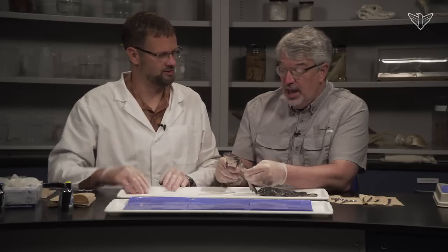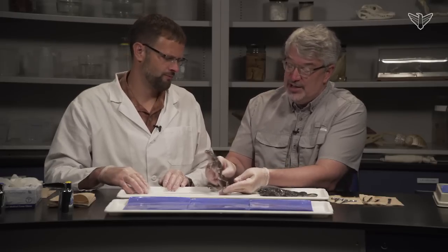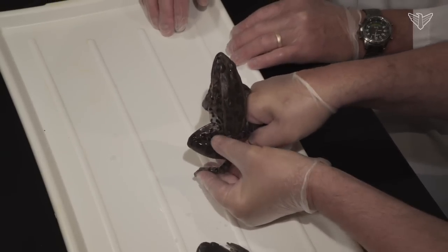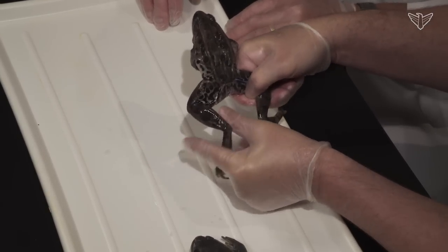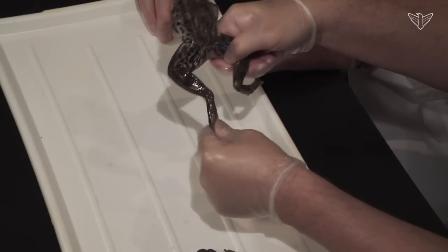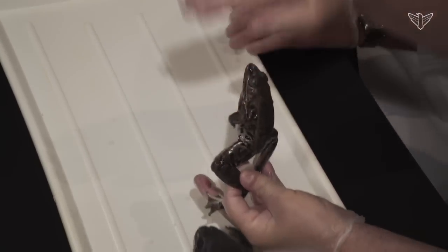There's something interesting about jumping. If you visualize this as the frog jumps: first the muscles of the thigh expand, then the shank, and then finally the foot actually pushes off. So it's like three forces pushing the frog forward. They're able to leap many body lengths — six, eight feet sometimes, some of these larger frogs.